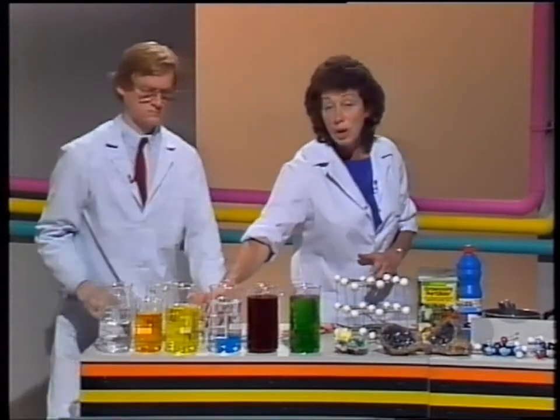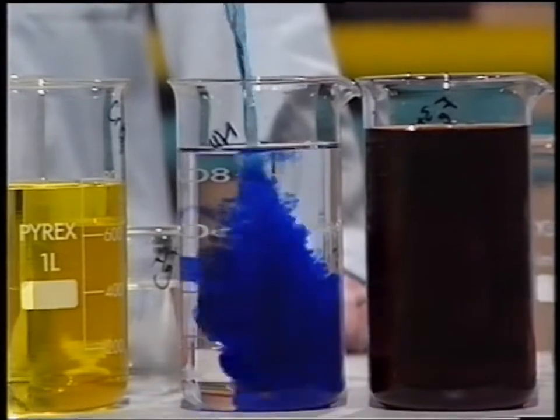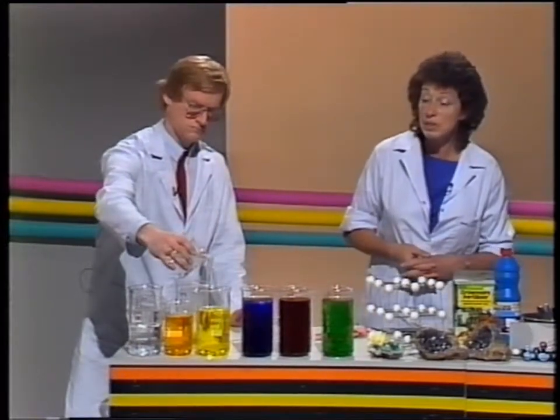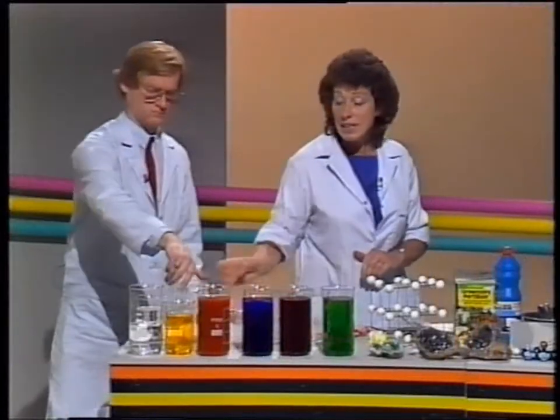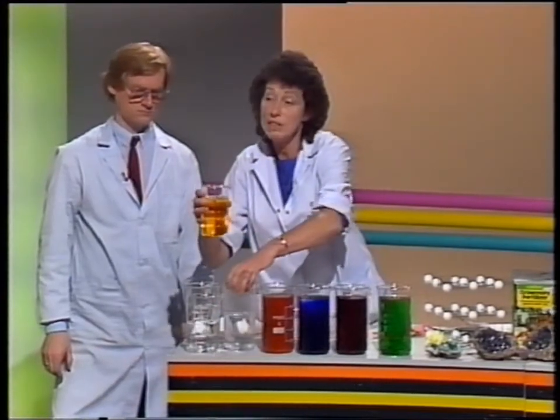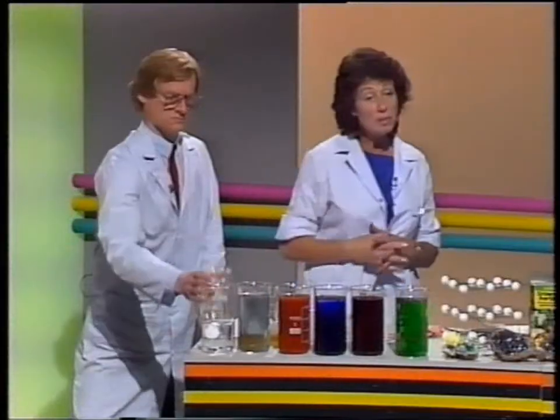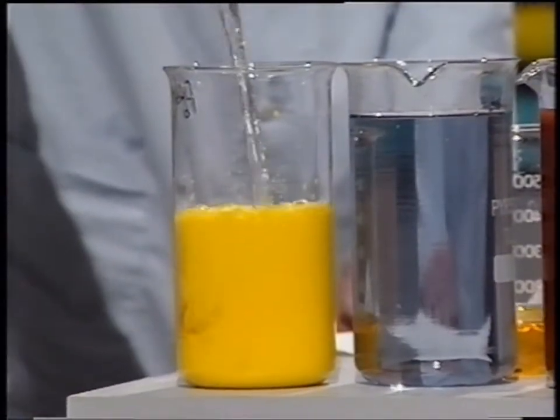The bright blue copper here can be turned into a nice dark blue by making a complex with ammonia. And silver reacts with chromate to produce a red precipitate, and you can see the solid forming as the liquids mix. And tin can react with this orange dichromate, and this is called a redox reaction, and the tin makes the orange dichromate go green. And a combination of lead with iodide gives us, as you can see, a really bright yellow solid.